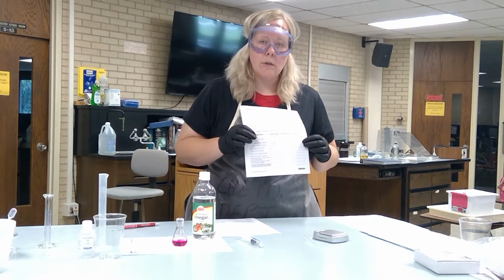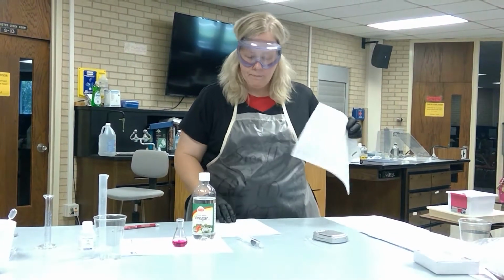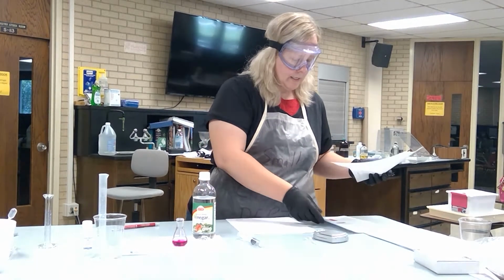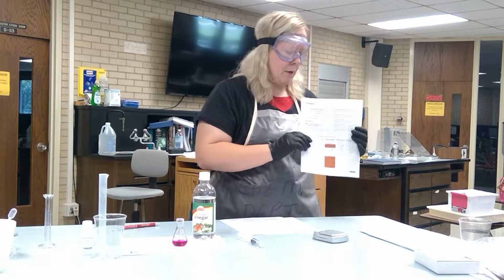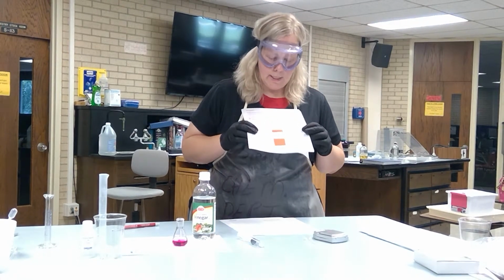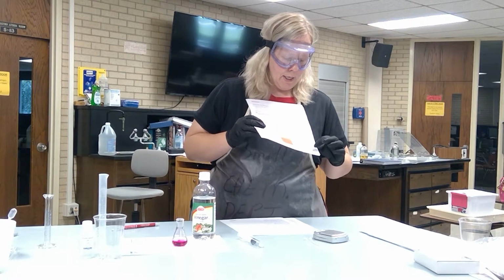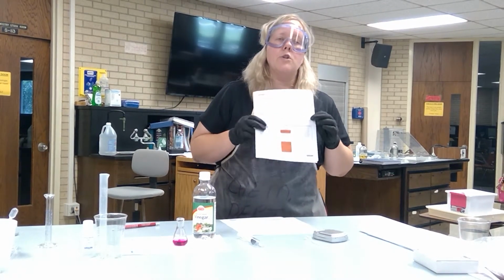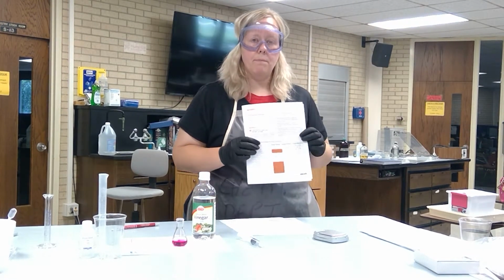You're going to pick a vinegar sample of your choice, repeat it all again, and that will conclude activity 1. And then activity 2, there's not an experiment to be done. You just have to complete the missing information on this table. They give you some of it, but in order to calculate these missing blanks, you need to make use of these equations. So this part here, just make sure you understand what you've gone through in this part before.